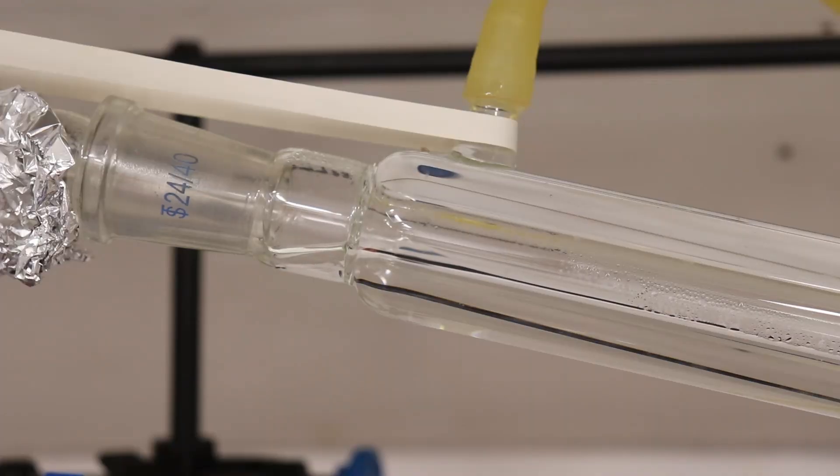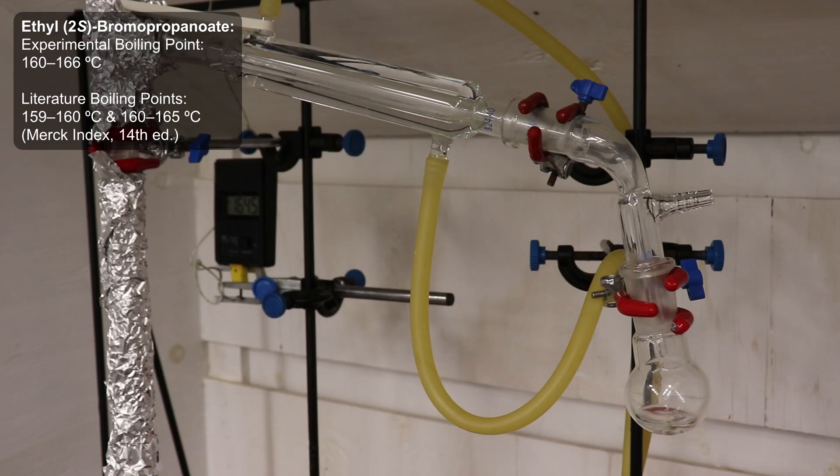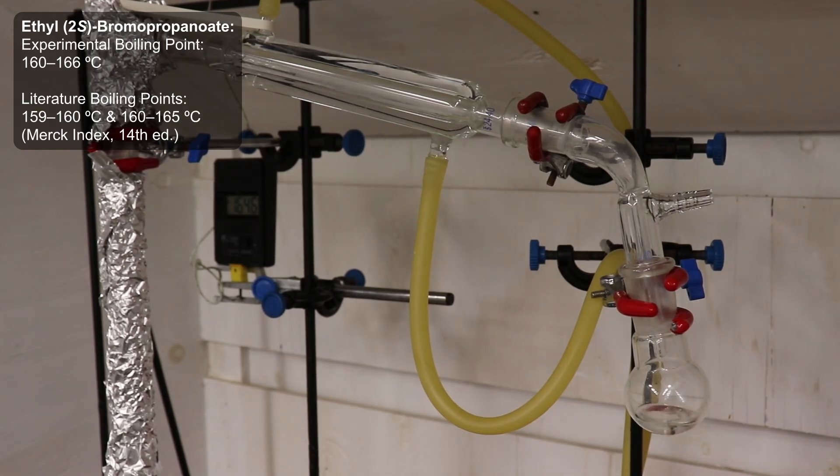The first few drops of distillate came over at around 160 degrees Celsius, however the bulk of the product distilled over between 164 and 166 degrees Celsius.